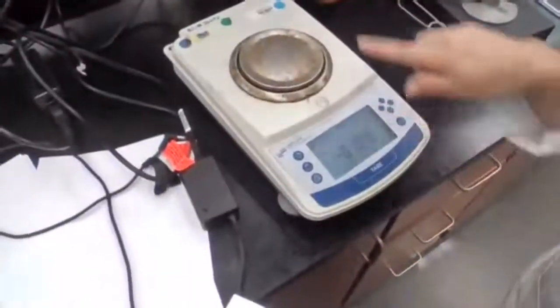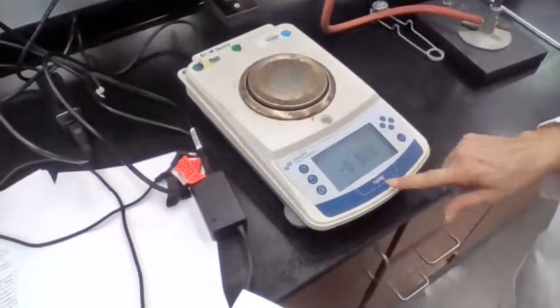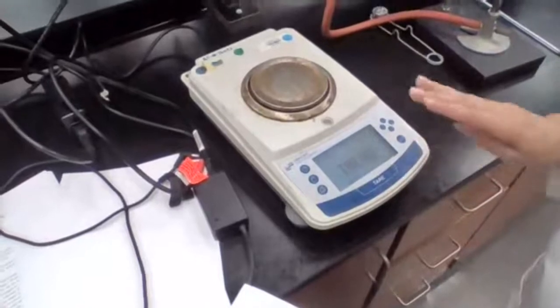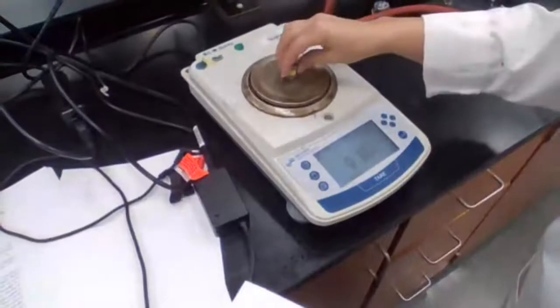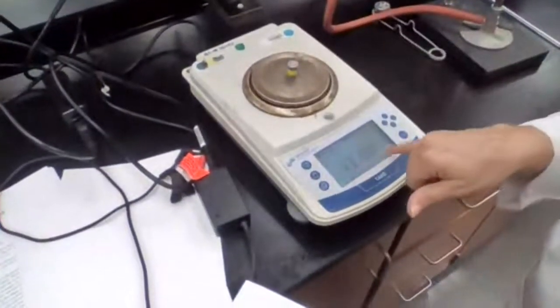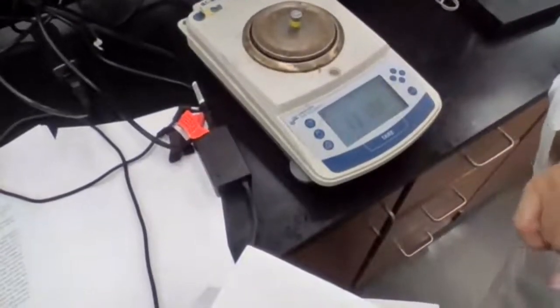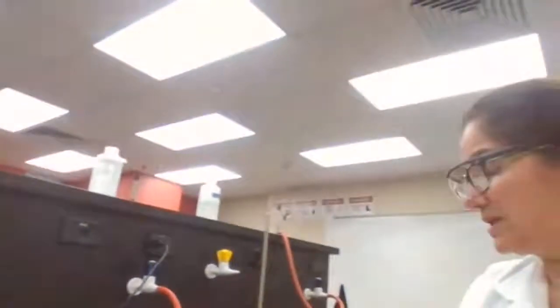The scale, you turn it on, you plug it in, then you press the tare button. When you press the tare, it's going to calibrate, and because there's nothing on it, it should show all 0. Then we place the object, and it shows the number with 3 decimal places, and that's what the procedure is asking us to record. The number is 13.185, and that is for 11.